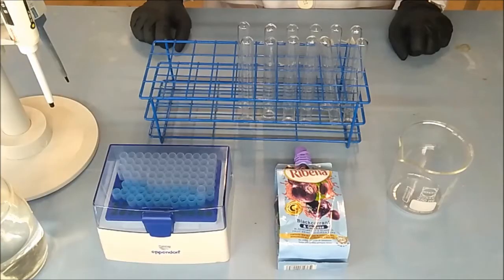Now, all the materials are ready. Let's begin with the experiment.